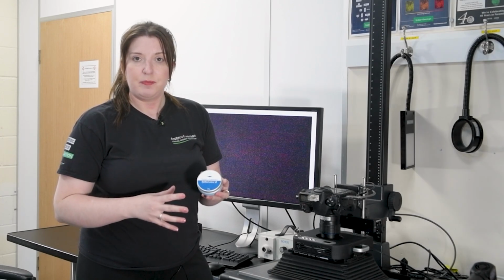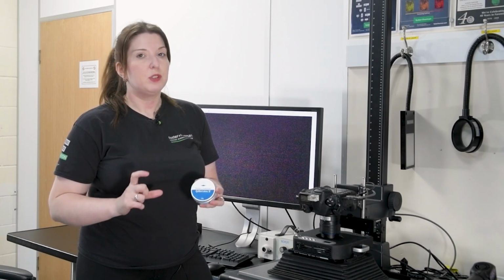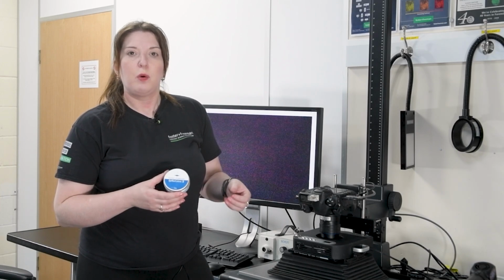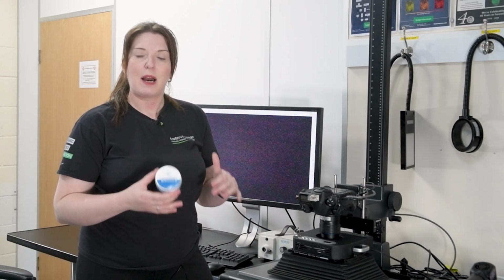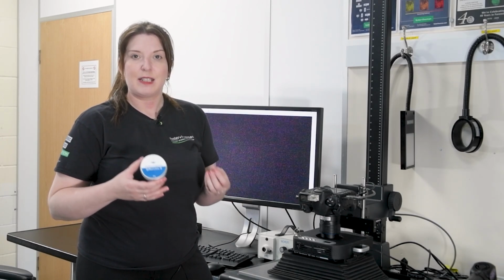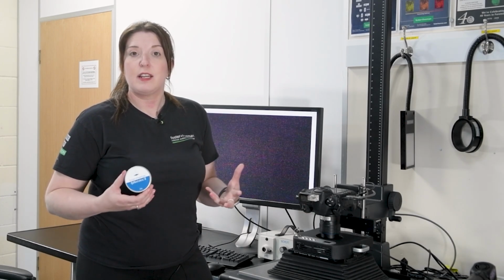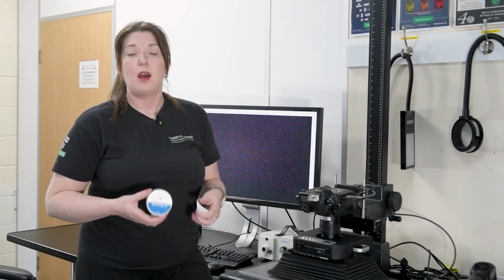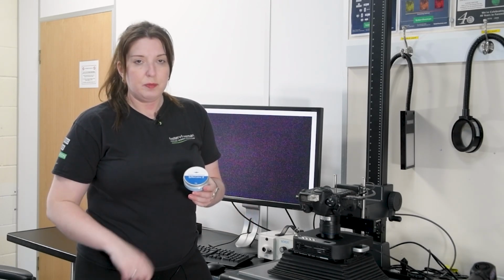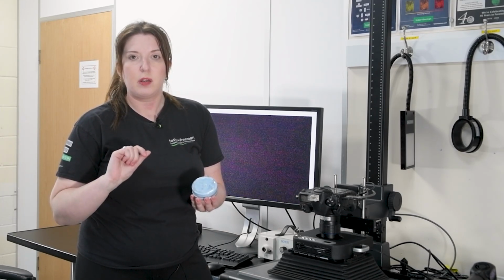FP Natural 2 powder is an infrared fluorescence powder. So it's very similar to what we've done, but it's slightly more special. Now, with infrared fluorescence, we're still trying to do that dropping out of the background. But what we're trying to do is create fluorescence inside the infrared part of the spectrum. And because we're creating that infrared fluorescence, we can see the bright fingerprints, but we can also try and remove the background surface. So FP Natural 2 is a very simple powder to use, simply applied on top of super glue with a Zephyr brush.